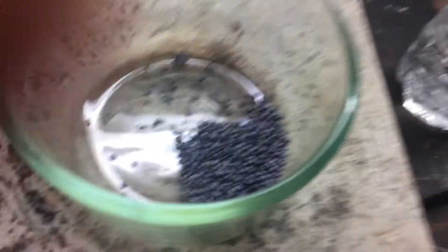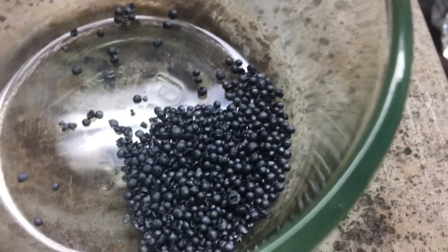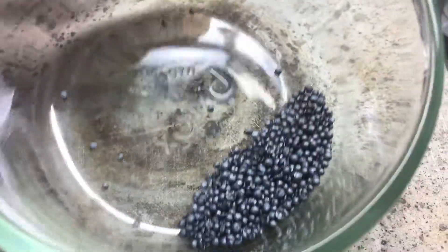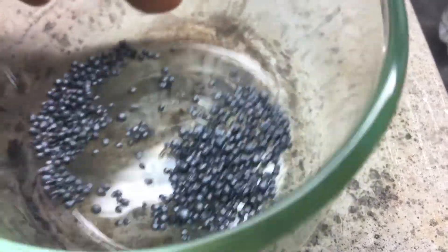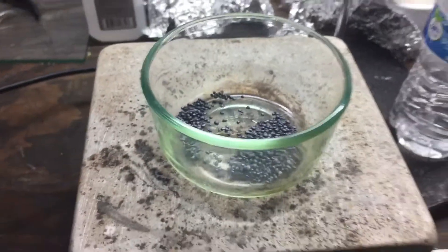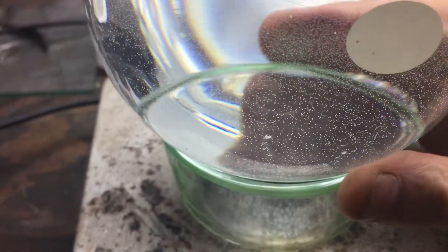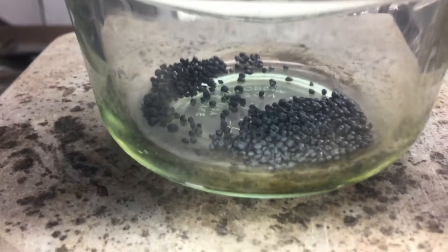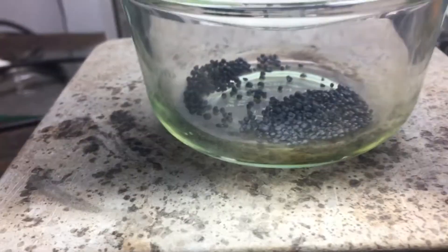Today I'm going to be doing an iodine recrystallization, and that's because you can tell that it has some metallic luster in some of the beads here, which are obviously in a prilled form, but you can't really tell any of the crystalline structures. So I'm going to recrystallize them by heating this dish here very slowly — about 113 degrees will probably offer enough temperature to speed up the sublimation process, which iodine naturally undergoes.